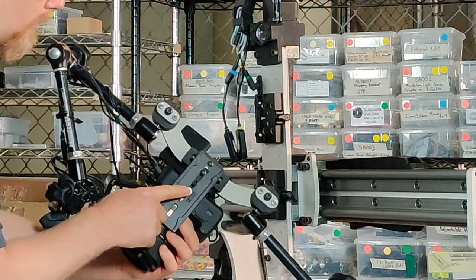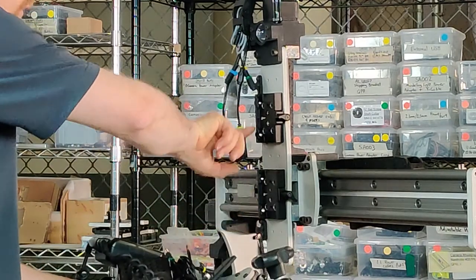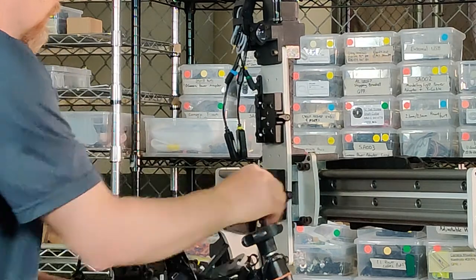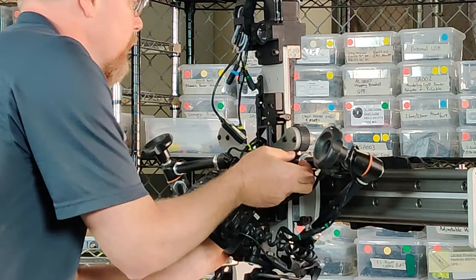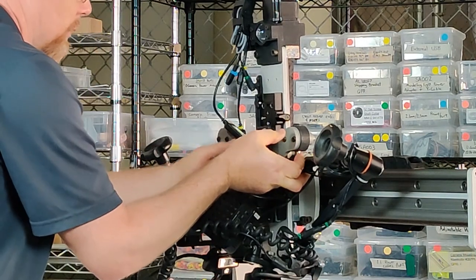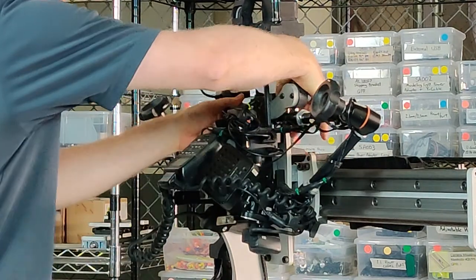The camera is held on back here, and there are two pins and two knobs here. You loosen those and then the camera will slide up into the first pin. Then press the pin to raise it up to the second one and tighten it.